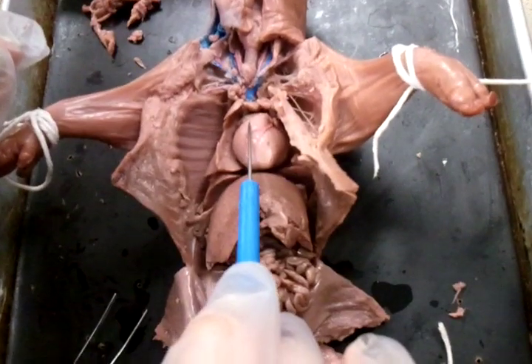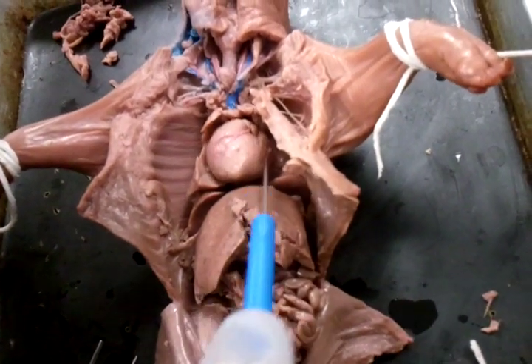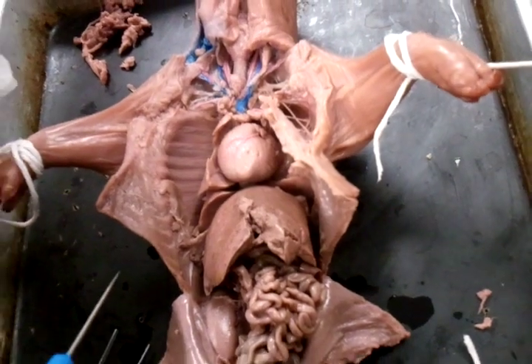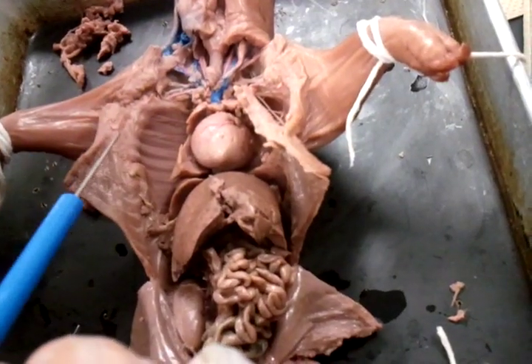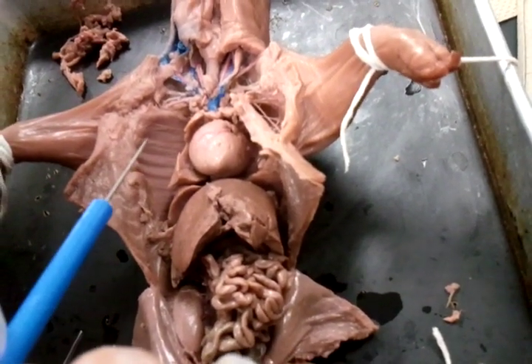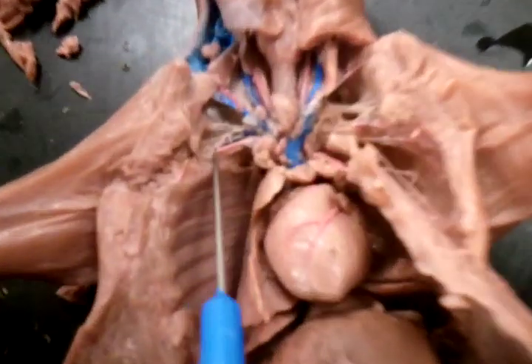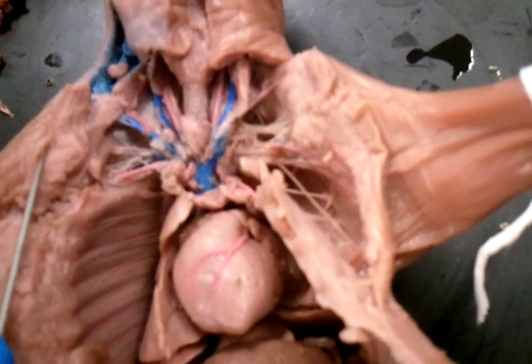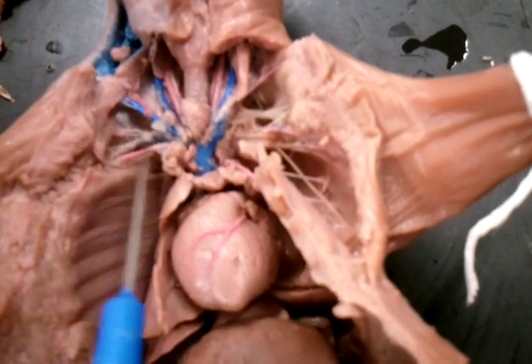Right ventricle — oh right — right ventricle, right atrium, left atrium, left ventricle. Auricle, oh we did that already. Common carotid arteries, we did that. We don't know any of that. Subclavian vein and arteries — subclavian artery. Just think clavicle, along this line. And subclavian vein, same thing, it's like right here.